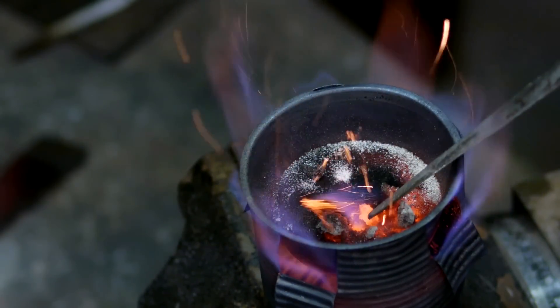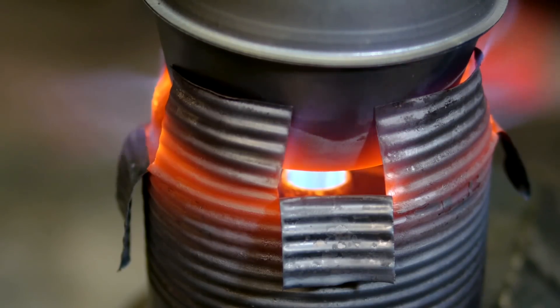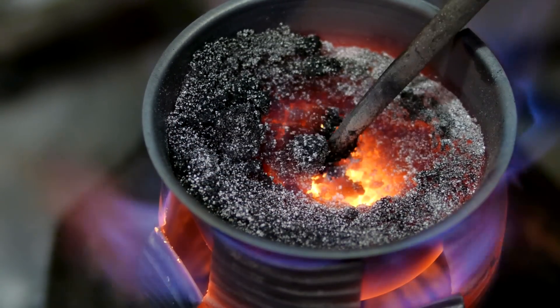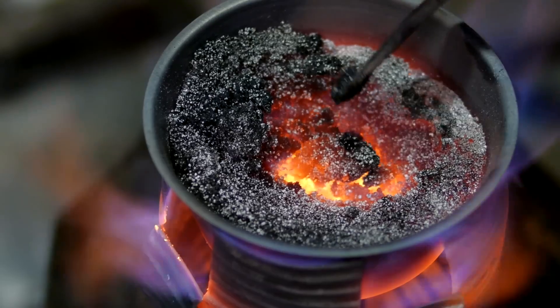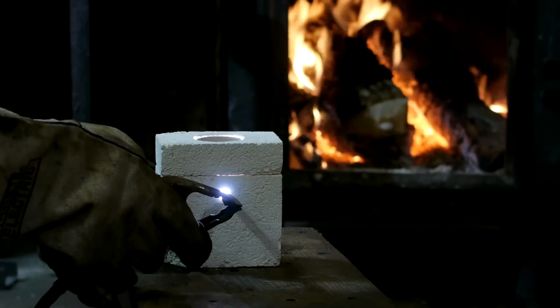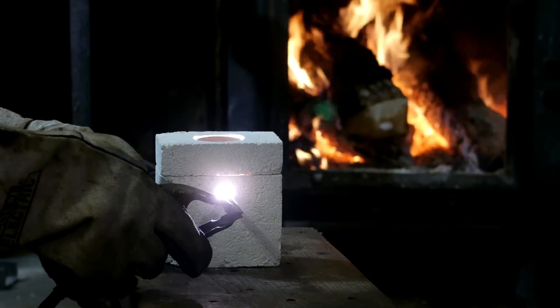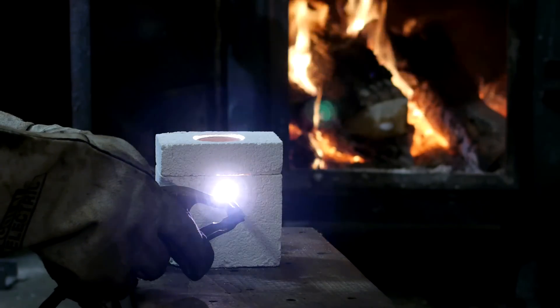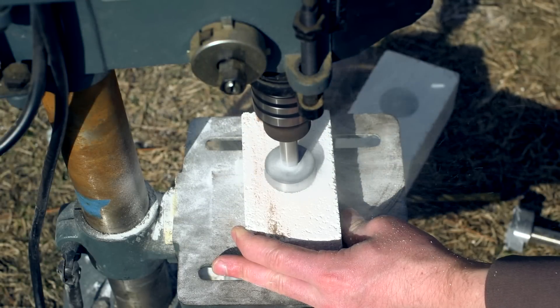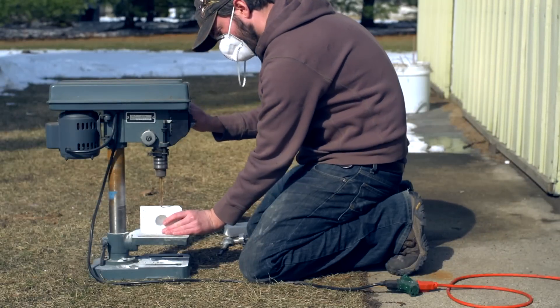This requires a lot of heat — well over a thousand degrees Fahrenheit. While the torch was hot enough to melt some of the potassium carbonate, it wasn't quite hot enough to get the reaction started. I decided to change the setup to utilize a much hotter heat source: an arc furnace utilizing carbon rods from a lantern battery and a fire brick as the housing. Grant Thompson has put together an excellent tutorial on how to make a furnace similar to this, so I won't repeat the process here.